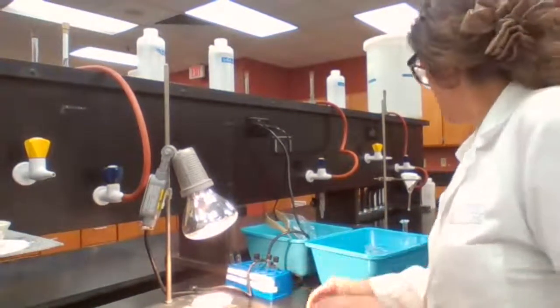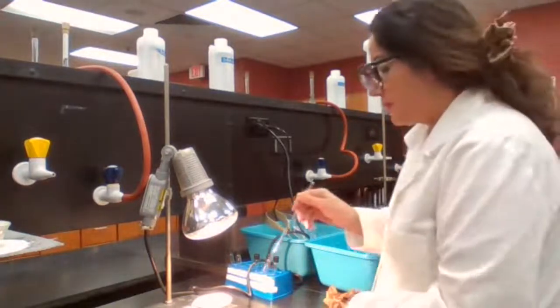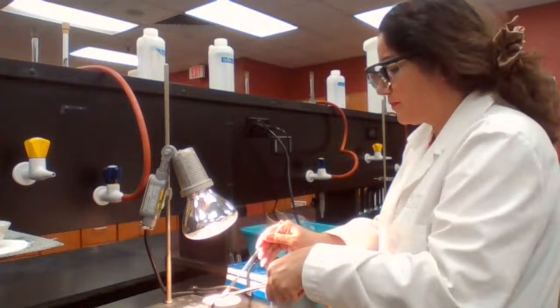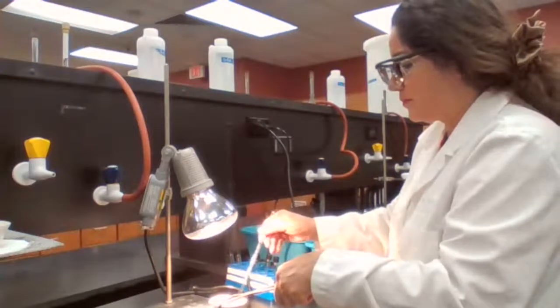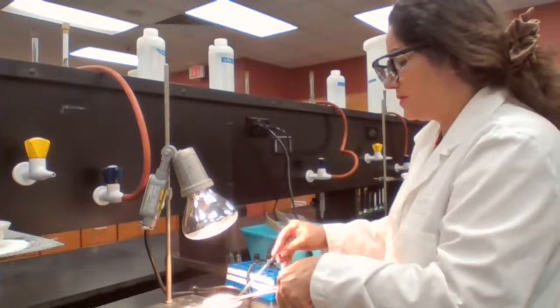So to be safer, I probably have to wait longer to make sure that it's completely dry. Maybe just 2 more minutes.